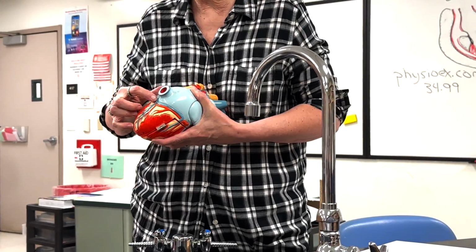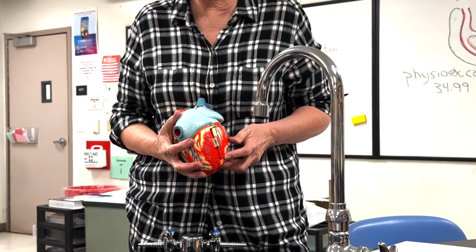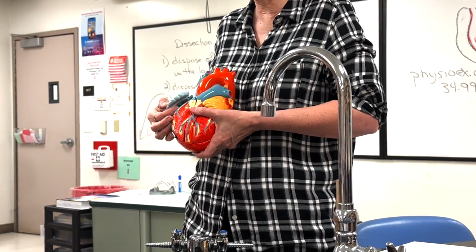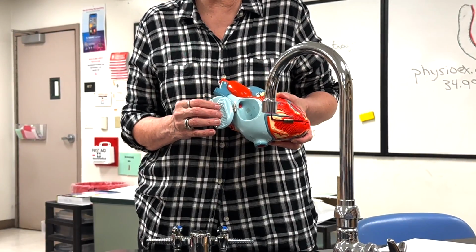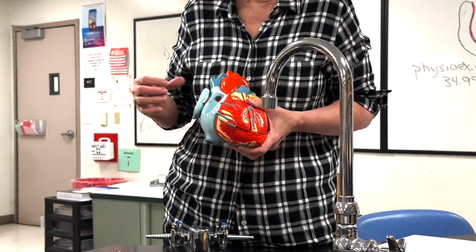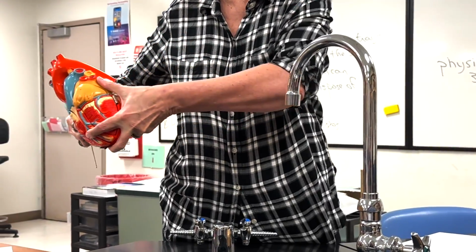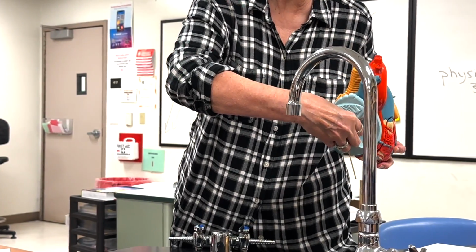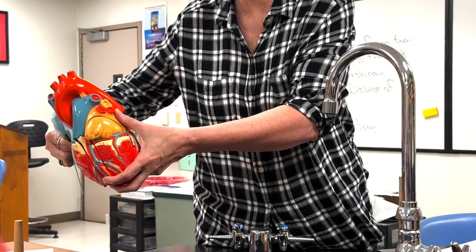So you can see it. It's going to empty in right there. When we look at the sheep heart, we'll be able to find the opening for the coronary sinus, right near the inferior vena cava. All right, so blood is now in the right atrium, and its auricle. Here, the right auricle. Both the auricles of the atria have these comb-like ridges of muscle called pectinate muscle. Ridge-like muscles in the ventricles are called the trabeculae carneae. Okay, the rest of the atrium is smooth-walled, and so that red circle right there is the inferior vena cava that has a kind of white arc around it. That's the opening for the inferior vena cava, and that smaller opening right beside it is for the coronary sinus.